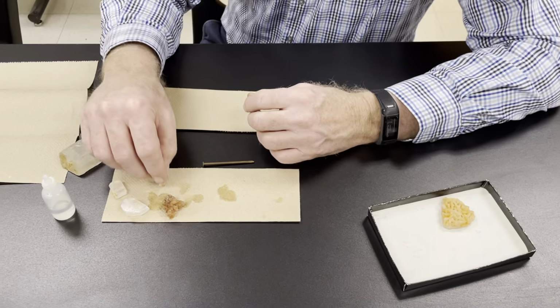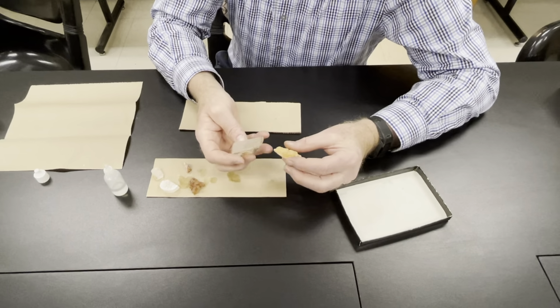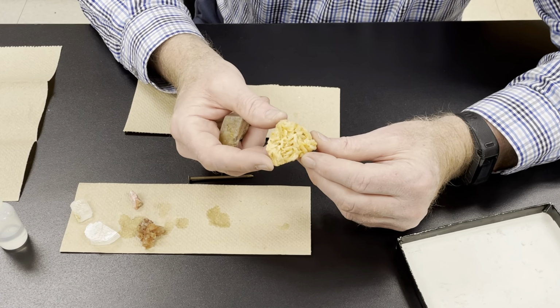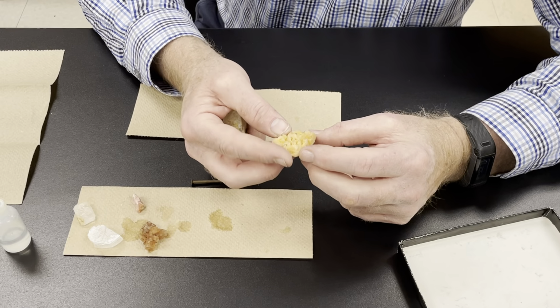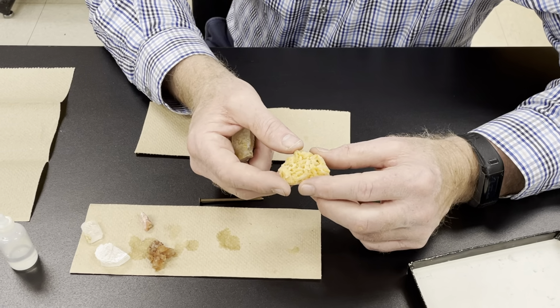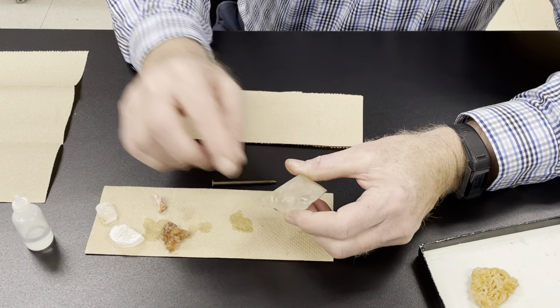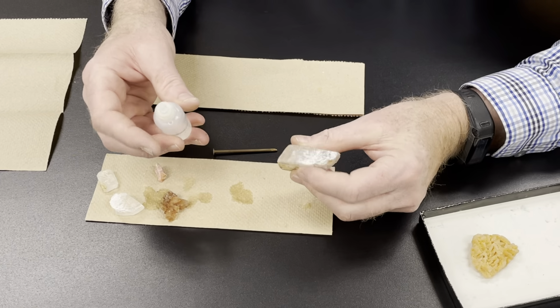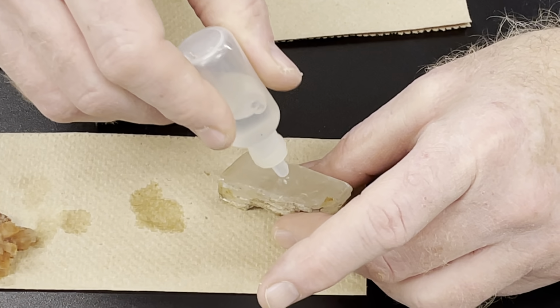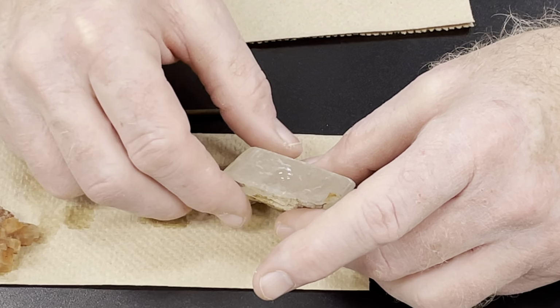Okay, now the last one I want to do is dolomite. These two are both dolomite. This one looks just like calcite. This one is a common form of dolomite. It has kind of these orange platey crystals. The problem with this sample is it might have some calcite in it too. So I wanted to get a pure dolomite. And I got a nice clean surface here. Well, there's some scratches. Let's do this surface. Okay. If I put it on here, I see no reaction. Nothing.